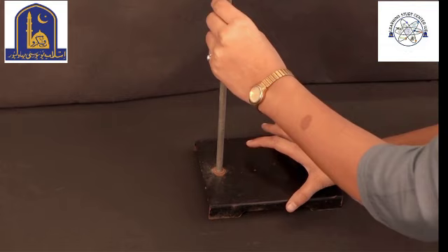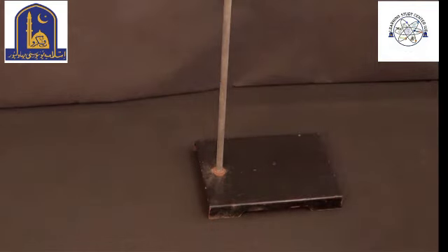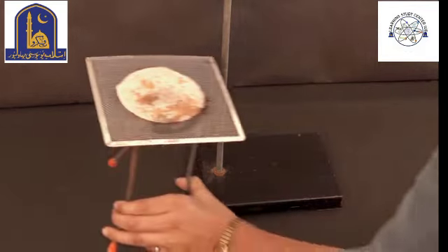Tripod stand, wire mesh, glass beaker, ice, thermometer, spirit lamp or burner.